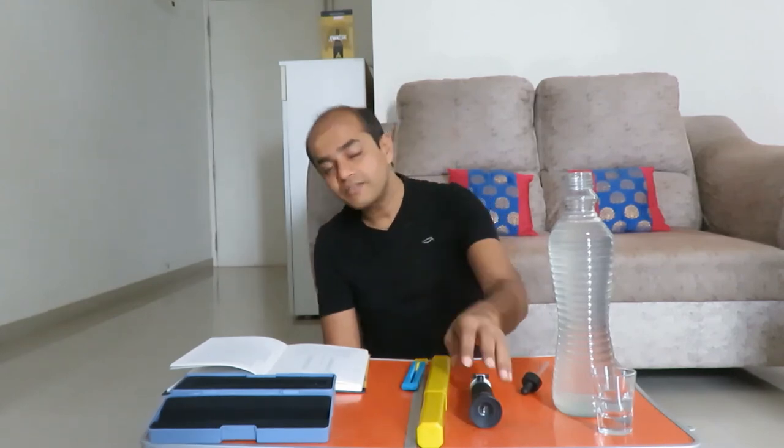Let me discuss the pros and cons of hydrometer versus refractometer. The refractometer is a very powerful tool — it is made of a much sturdier material than glass, so it can handle rough handling. More importantly, it only requires one or two drops rather than 250 ml or one liter of solution. This is advantageous if you have your own orchard or vineyard — you can take a small sample on-site without plucking many fruits, or even use it at a fruit market to pick the ripest fruit for fermentation.